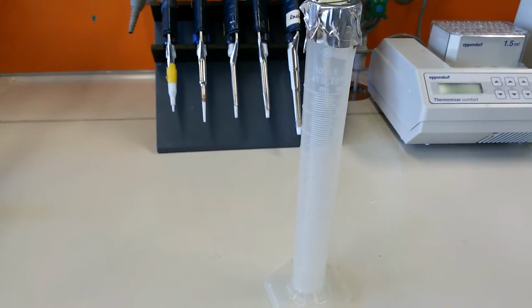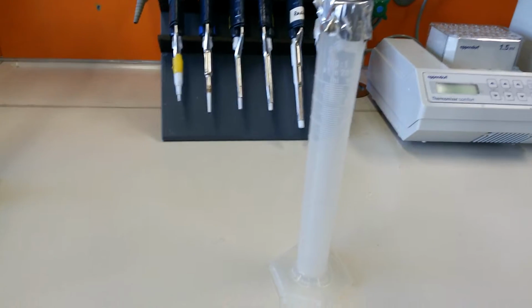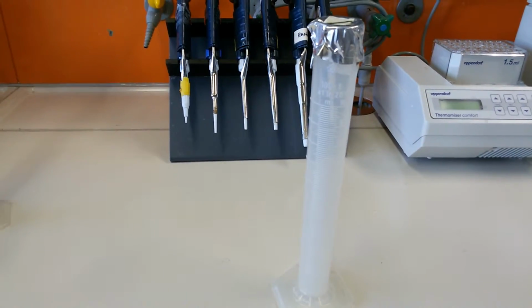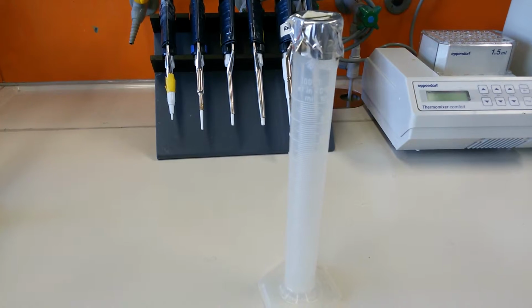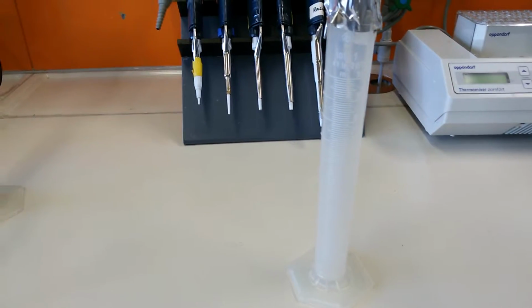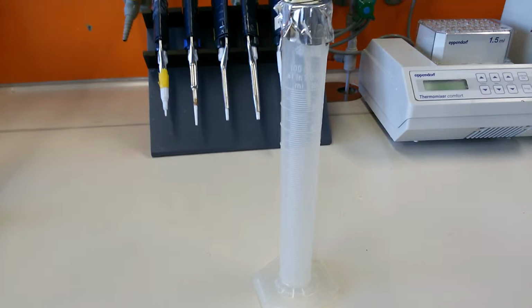Okay guys, so this video is about the lab utilities. In this video we will tell you about the basic components that you should know about, what there are in a lab, and you should be aware of them. Even if you don't know in detail, it's okay, because we can provide you some information on that. I just want to introduce to you what they are and how they look, so that when we talk about them in our different video lectures, you feel that you know them, at least by term.